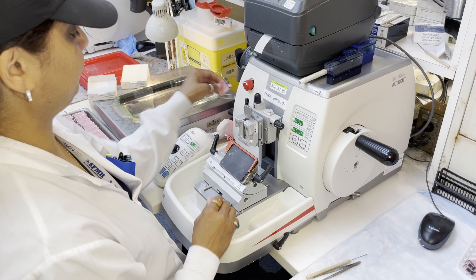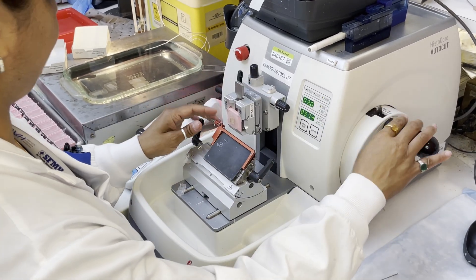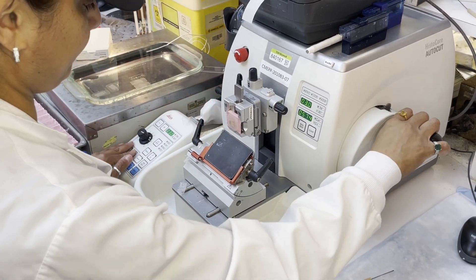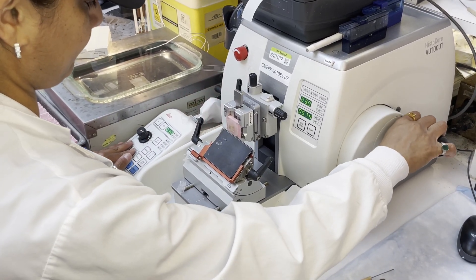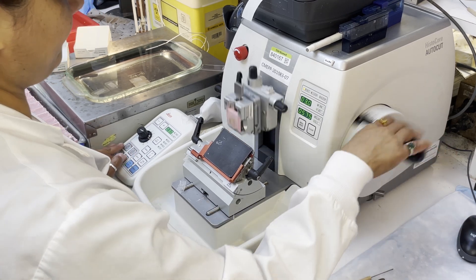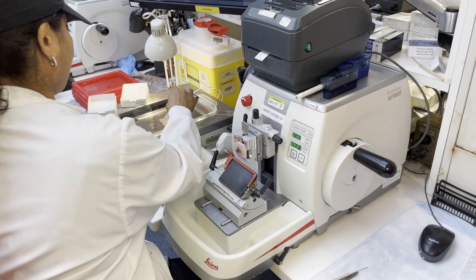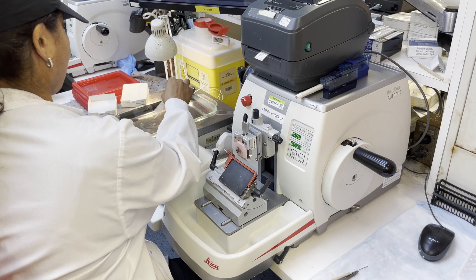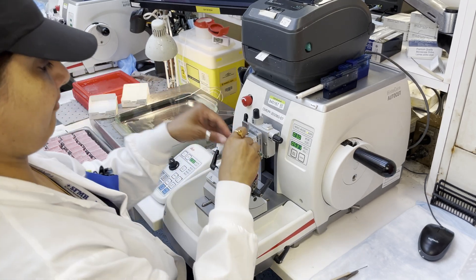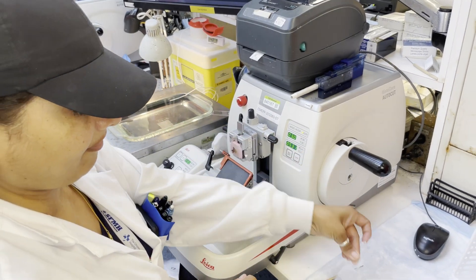Next, the tissue sample, now fully embedded in a wax block, is moved to the microtomy station. At this station, a technologist cuts the tissue into ultra-thin sections. The tissue sections are moved into a water bath before being placed on a glass slide.